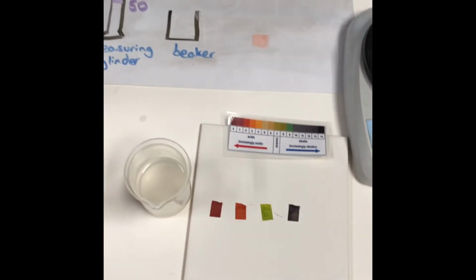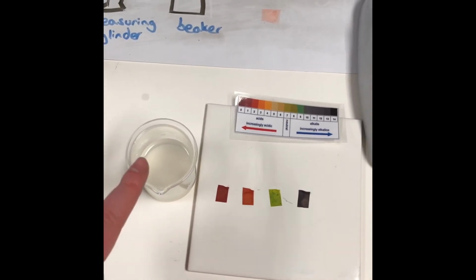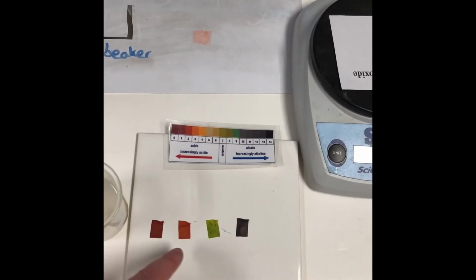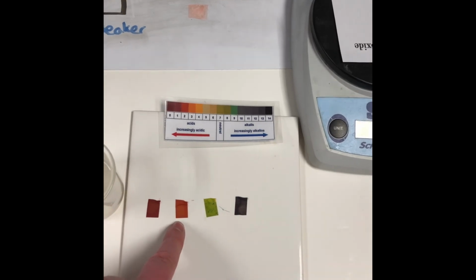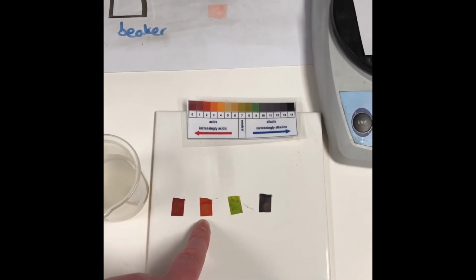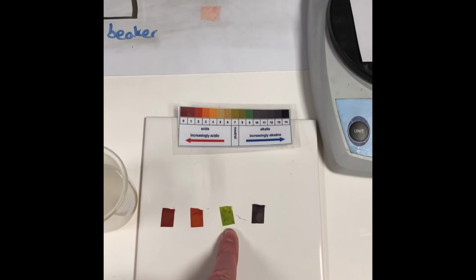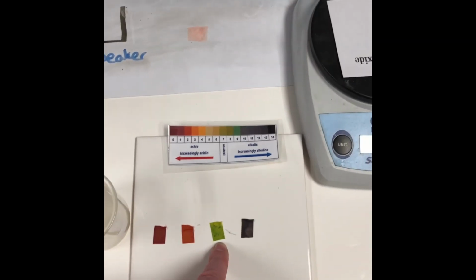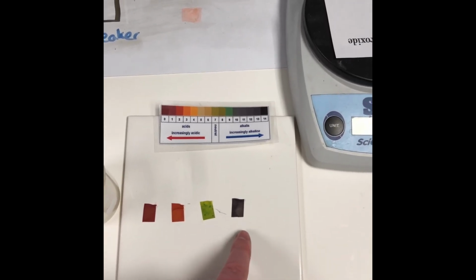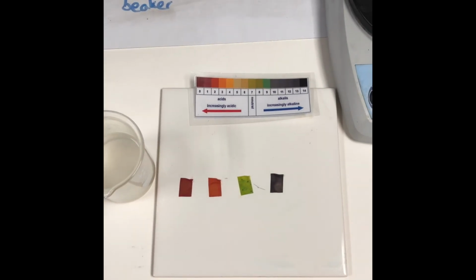So what I've done is I've added some calcium hydroxide into my beaker of acid, and then I've measured the pH using these pieces of indicator paper. And once I've done it once, so this is the first time I did it, I added some calcium hydroxide and got this reading, and you can see it's slightly less dark red, and so we're looking here at a pH of about 3. I then added some more calcium hydroxide and stirred it and tried again, and you can see I got this greeny colour, which you will know and recognise as being about pH 7, 8 or 9, so close to being neutral. I then added a bit more, and very quickly it went this dark purpley blacky colour, which you know and can see is a pH of about 12 or 13.